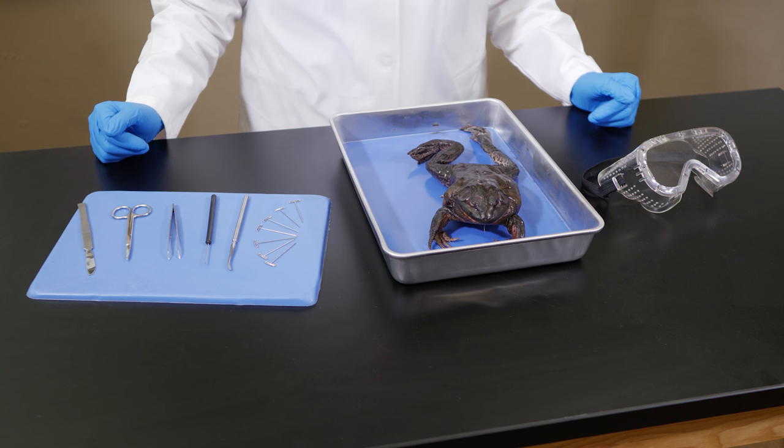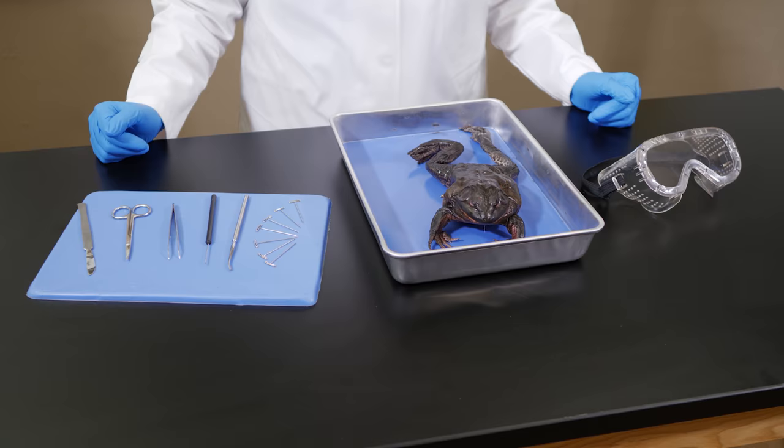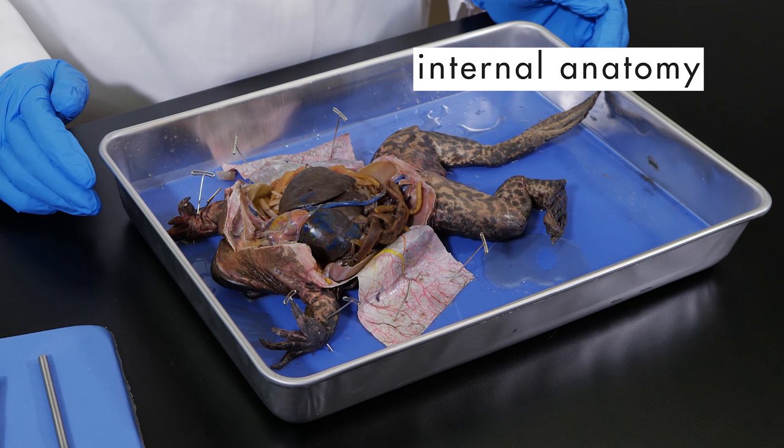However, a visual examination of its external anatomy will not tell us much about its internal structure. It does not let us see the animal's digestive, circulatory, or skeletal systems. In order to discover the details of how an animal is designed, we must look inside it. The internal features of an animal are part of its internal anatomy.